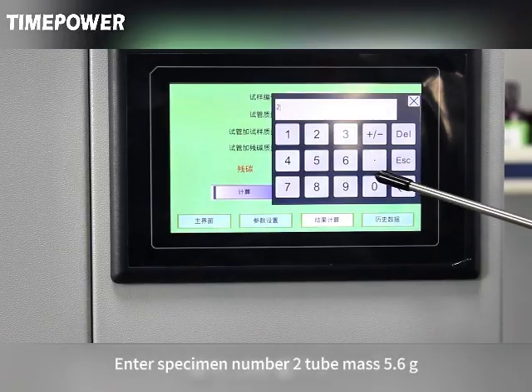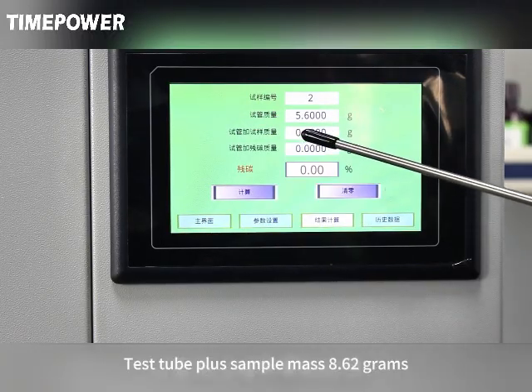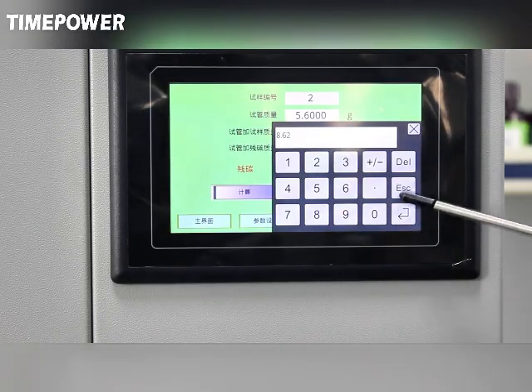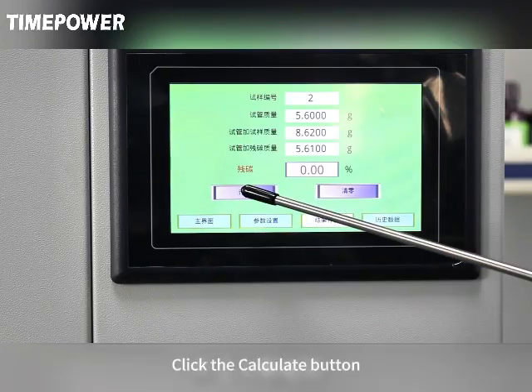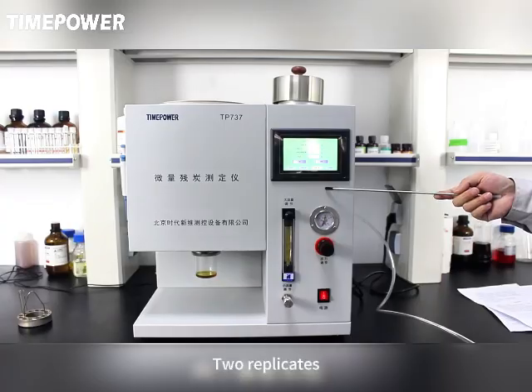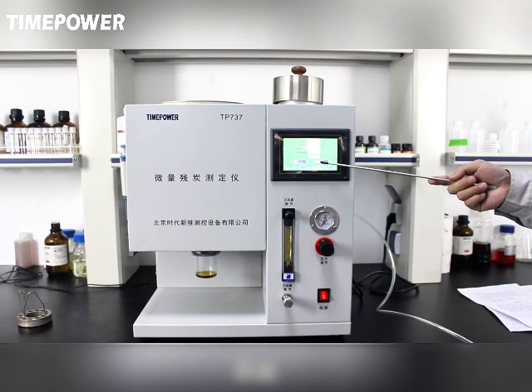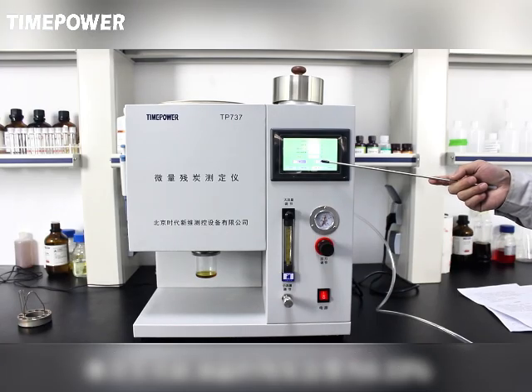Enter sample number 2, tube mass 5.6 grams. Test tube plus sample mass 8.62 grams. Test tube plus residual carbon mass 5.61 grams. Click the Calculate button. For sample number 2, the residual carbon is 0.33%. For the 2 replicates, the arithmetic mean of the result is 0.33%. Therefore, the residual carbon content of this oil in this experiment is 0.33%.